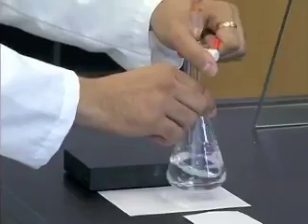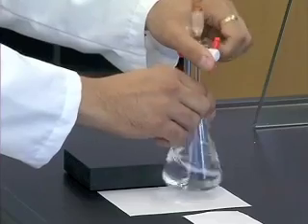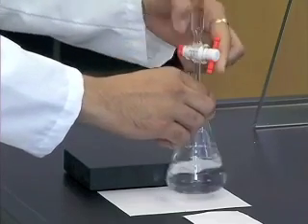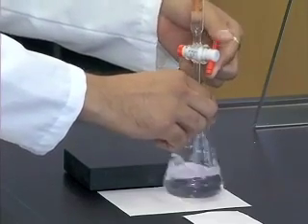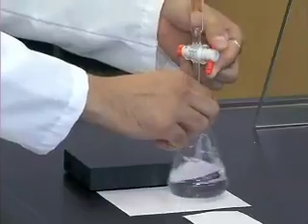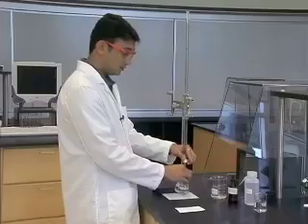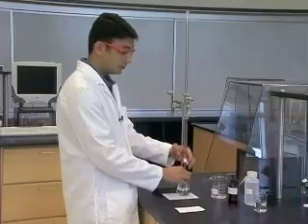The endpoint is reached just when the faint pink color is retained by the solution for about 15 to 20 seconds. Just when you notice that the pink color persists and does not change or disappear upon agitation, it is time to close the stopcock.